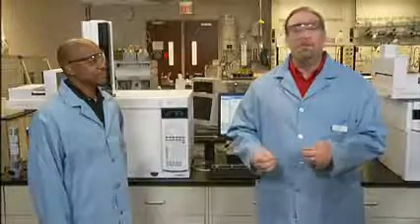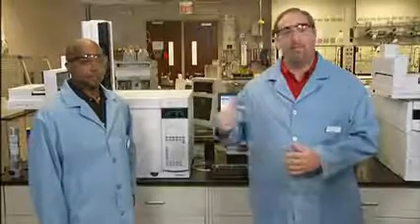Okay, so you still got baseline noise. Bake out didn't solve it. If you just did some maintenance or made a new installation of a column and the noise suddenly showed up, you should consider whether the column is installed correctly. If you're a new user, this may be a good place to start, and quite frankly, even us old timers make mistakes in this area as well from time to time.